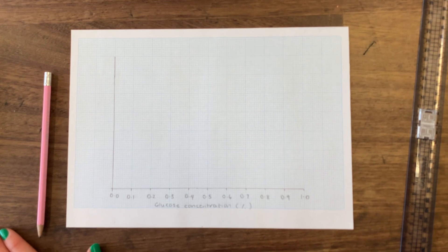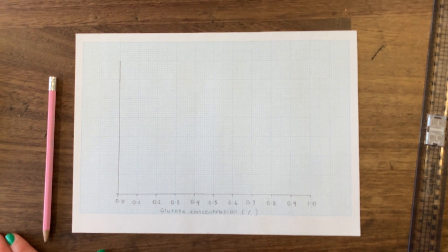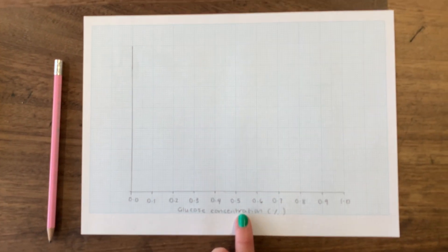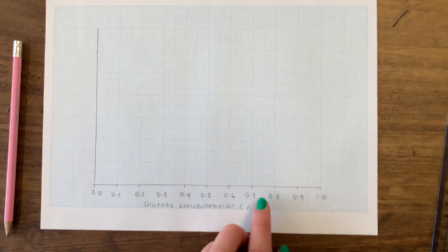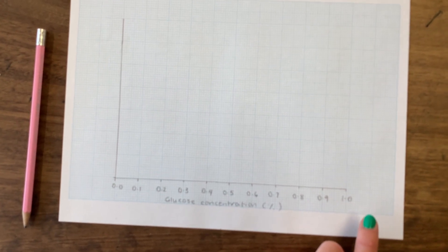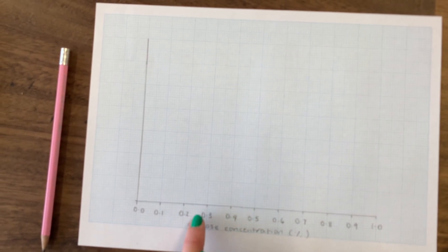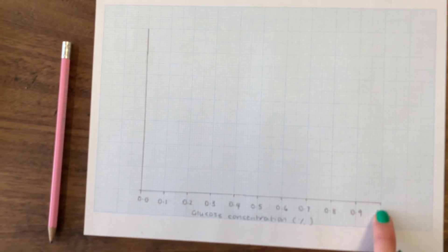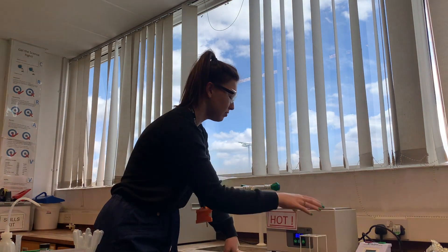While I'm waiting those 15 minutes for my test tubes in the water bath, I've started to draw my calibration curve. Our independent variable - the thing that we've changed - is glucose concentration, so I've got that on the x-axis. You must make sure that you have a linear scale, because this is continuous data. We could have chosen any values for glucose concentration between zero and one, so the lower points are quite close together, and there's a bigger jump from 0.25 to 0.5 and from 0.5 to 1 - you don't want those to be evenly spaced.